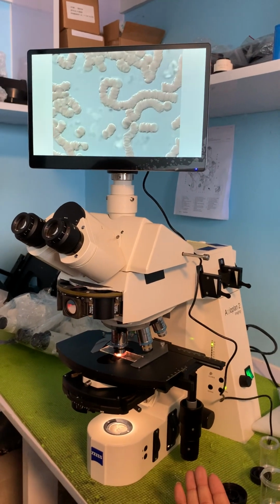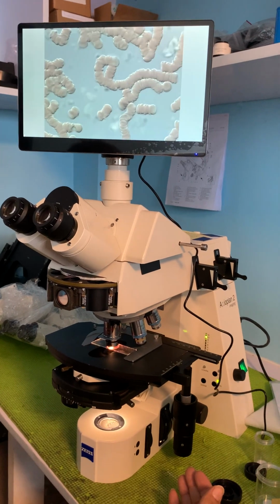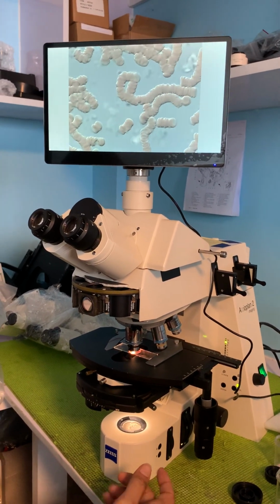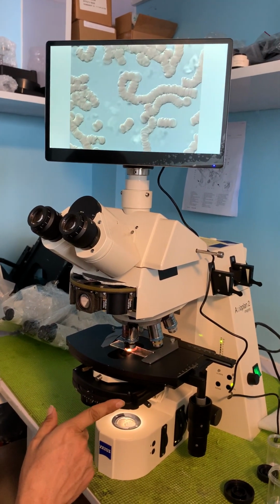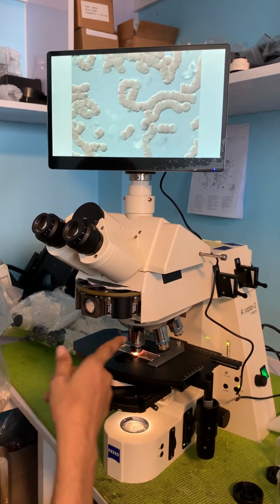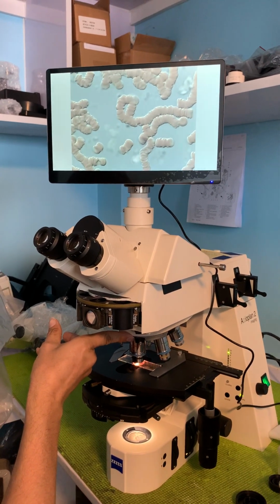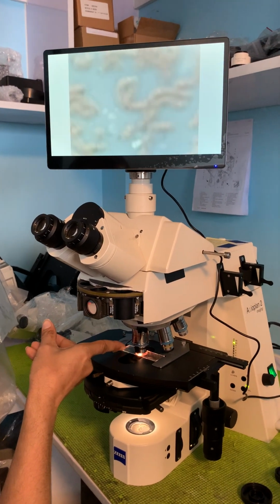Okay, we have a Zeiss Axioplan 2ie imaging, and we have this set up with DIC. It's a transmitted light DIC. We have a DIC prism in the condenser, and it's also a polarizing condenser, and we have an analyzer in the cube turret, and we have another DIC prism just above the objective. And we have a live blood sample on the slide.